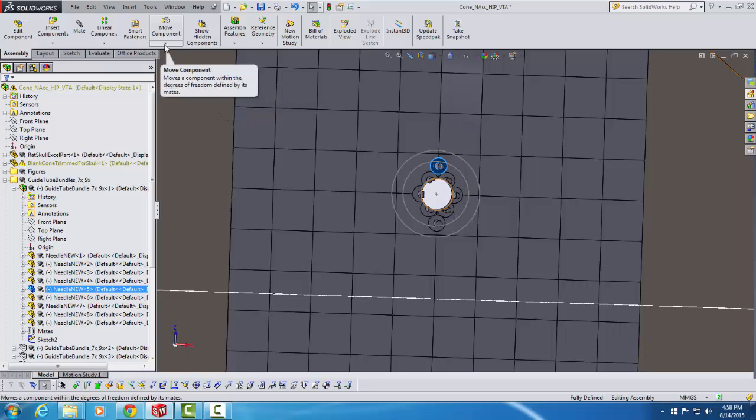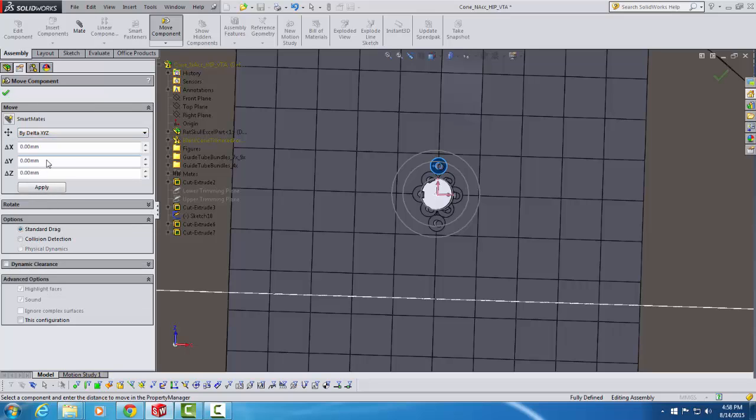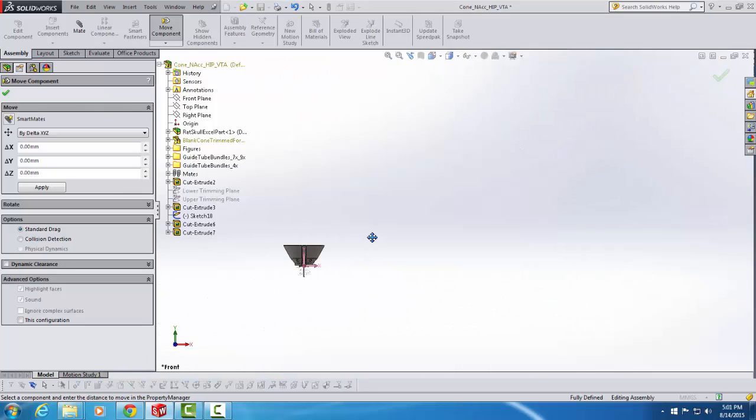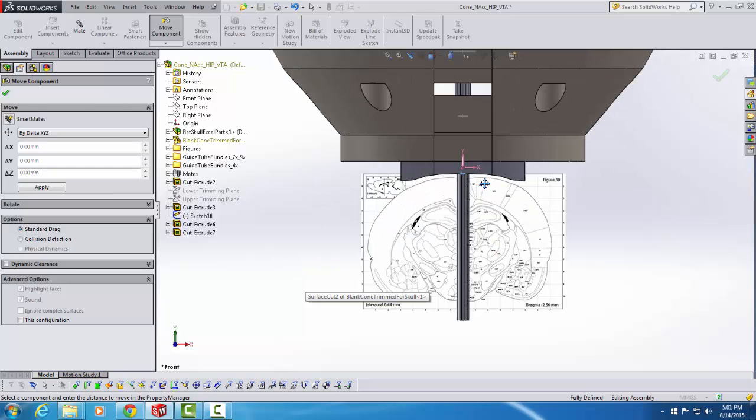And I do that by going up here to Move Component and pulling down this menu and then clicking on Move Component. And then you'll see this menu appear on the left, and I'm going to change what it says Free Drag here to by delta XYZ so that I can move by a delta XYZ value. Now, before I explain how to move it, it's important to explain what these XYZ coordinates correspond to. So to do that, I'm going to go to the View Orientation button. And from here, I'm going to choose a frontal view and zoom in on that so you can see a view of the figure from directly in front.